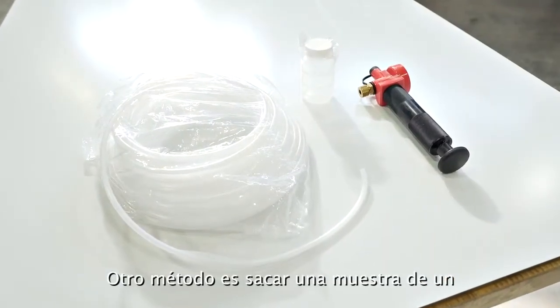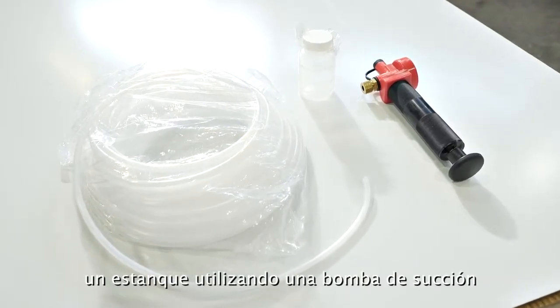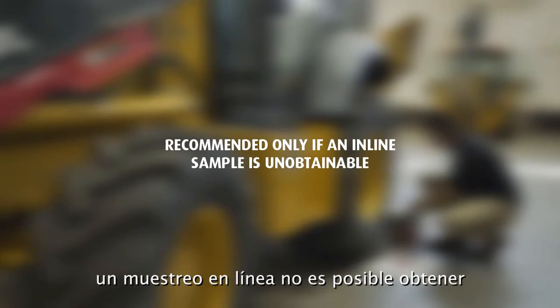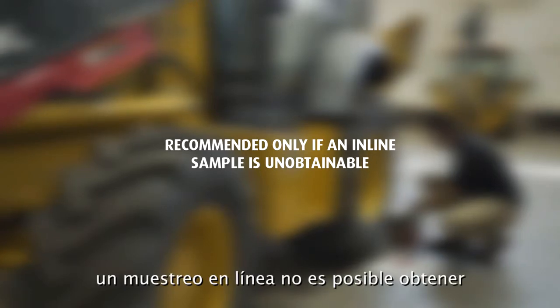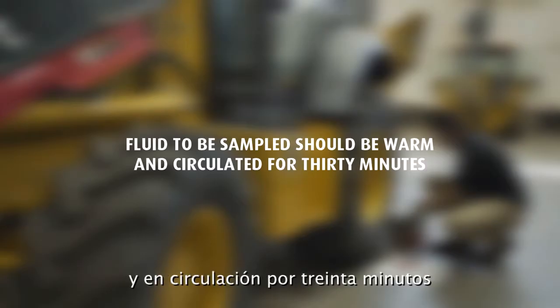Fill out the sample information form completely and submit the form and sample to the designated regional lab for testing. Another method is pulling a sample from a reservoir or sump using the vacuum pump with tubing. Obtaining a sample from the reservoir is recommended only if an inline sample is unobtainable. The fluid to be sampled should be warm and circulated for 30 minutes in order to obtain a representative sample. Fluid and equipment that has not been operating and is cold allows information such as wear metals and contaminants to settle out in the reservoir.